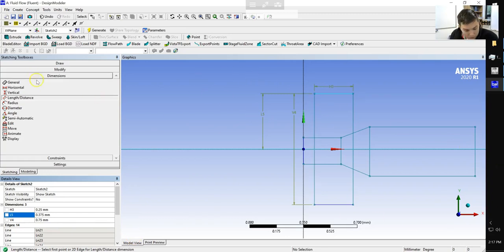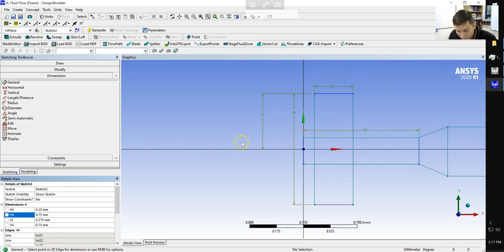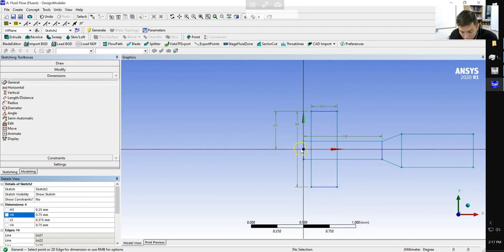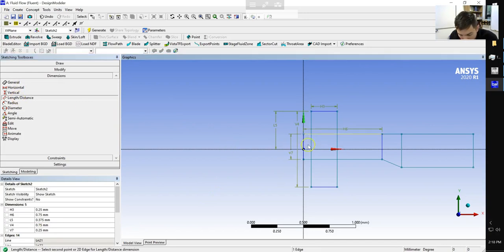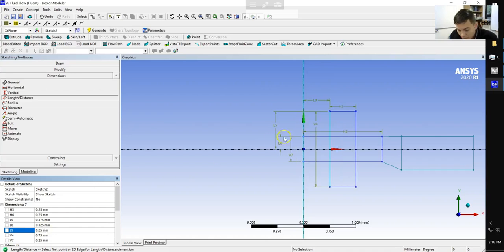When we go ahead and set this dimension next, this is also the length of our horizontal rectangle, which is also going to have a distance of 0.75, which nicely pushes everything out. And our height is going to be 0.25, with a distance to the x-axis of half of that, which would be 0.125. Our distance to the vertical rectangle is going to be 0.25. So now we can nicely see our plus sign showing up here.